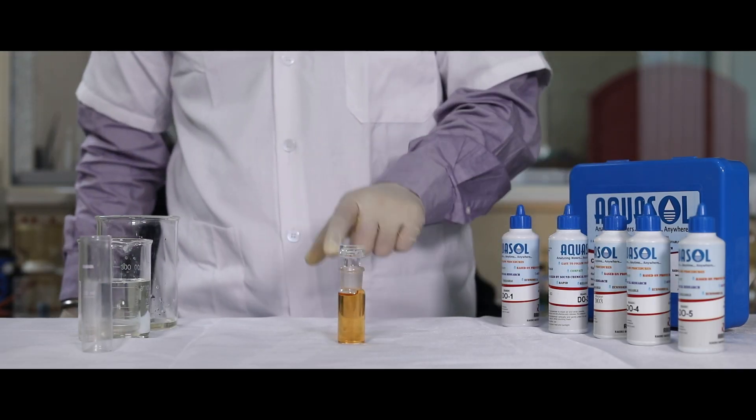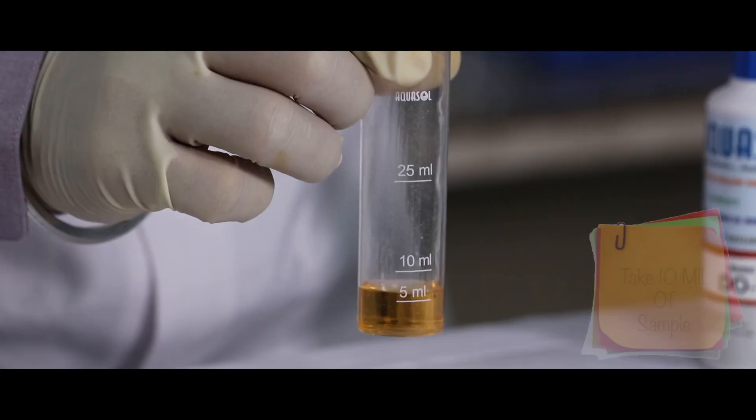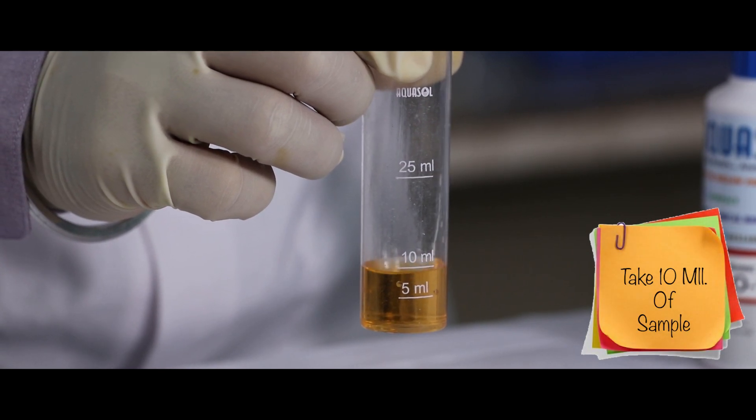Now the sample is ready for testing. Take 10 ml of sample prepared in the test jar.